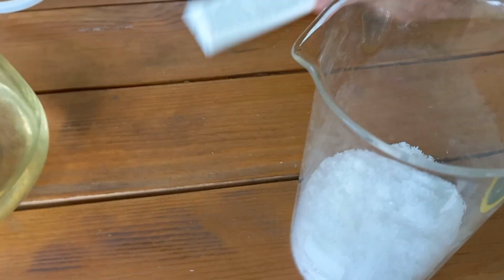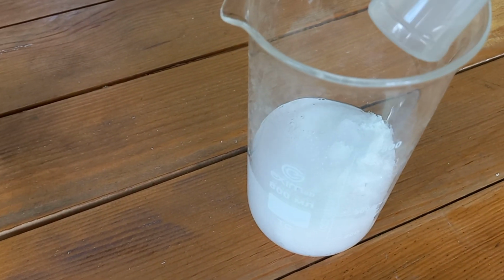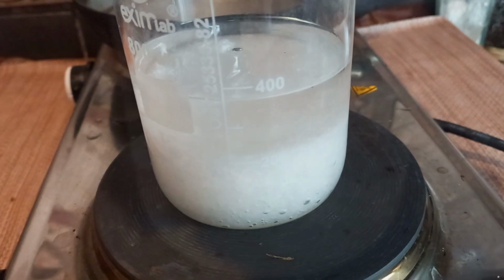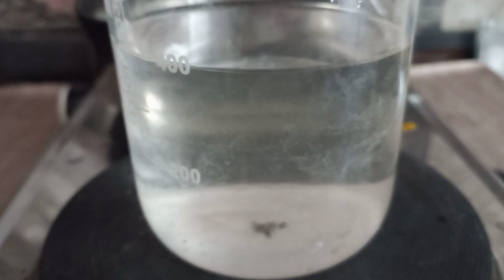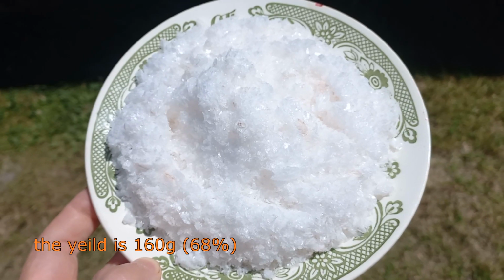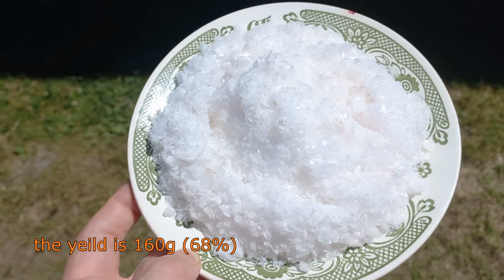In the end, I obtained almost 200 grams of product, slightly contaminated with sulfuric acid. I like to work with pure substances, so I recrystallized it from 200 milliliters of methanol. After 1 day in the fridge, I filtered out pure dimethyl oxalate. Here is my final product with a yield of 160 grams, much higher than when using undried oxalic acid.